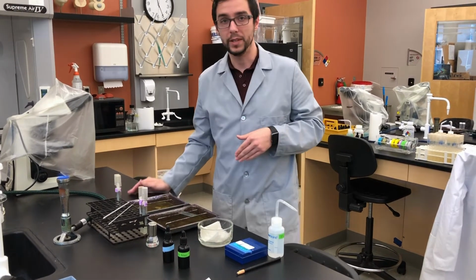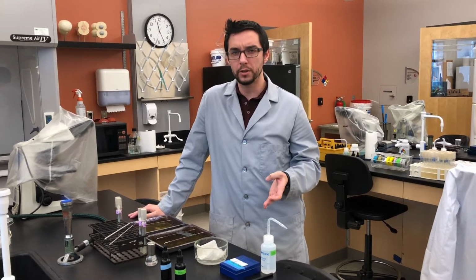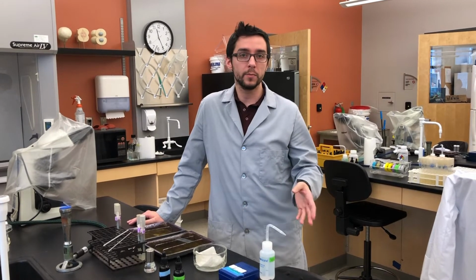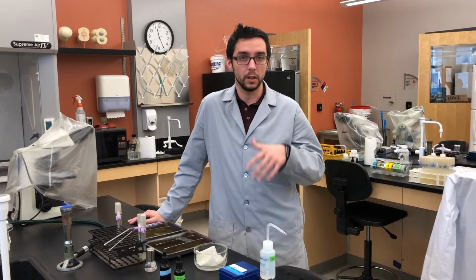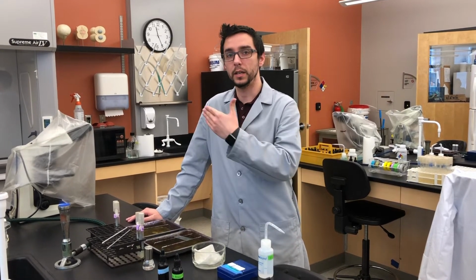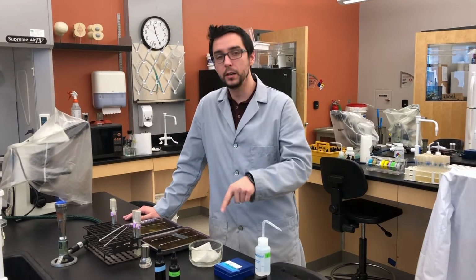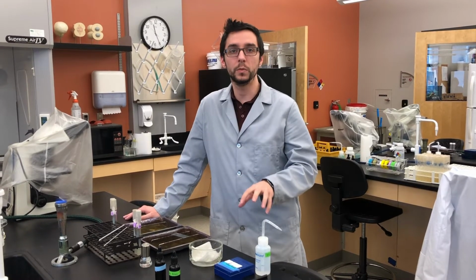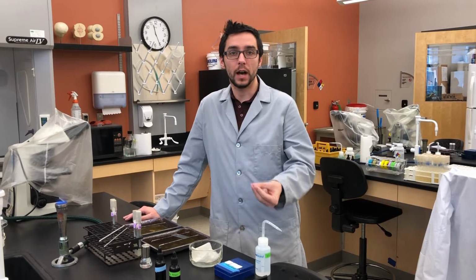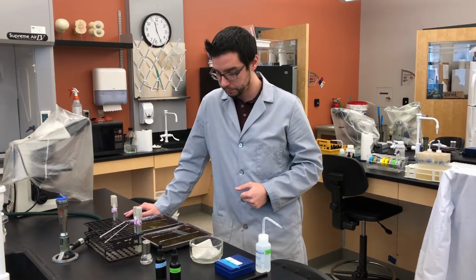Now, why do we microwave it? The heat from the microwave will function as a mordant. Where have you heard that term before? We've used that term for iodine in gram stains. The mordant helps lock the color in. In this case, the heat is functioning as a mordant to help get that malachite green color into the endospore forming bacteria, and it'll lock that stain into the endospore structure, okay?